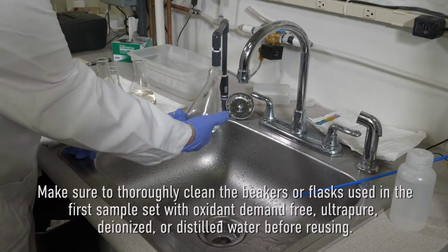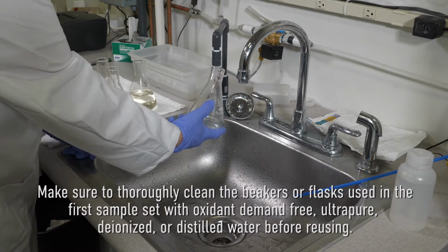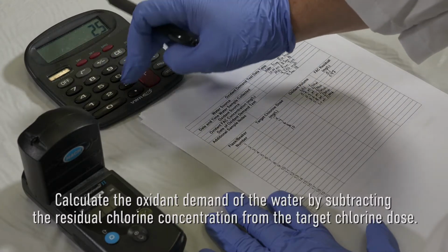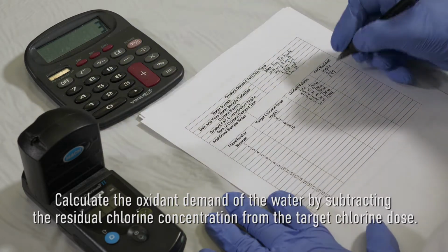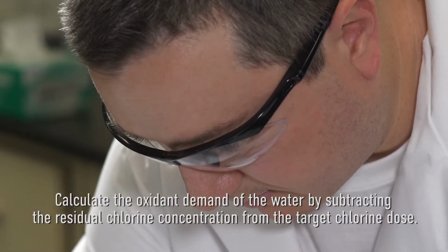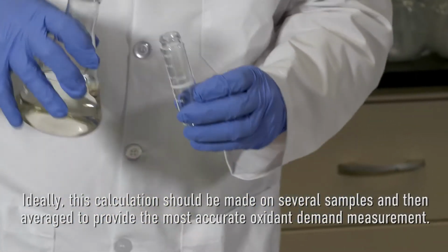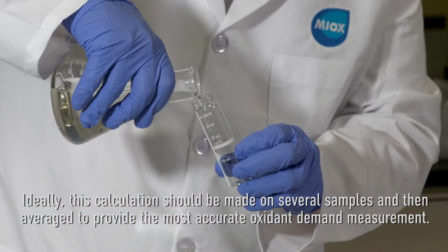Make sure to thoroughly clean the beakers or flasks used in the first sample set with oxidant demand-free, ultra-pure, deionized, or distilled water before reusing. Calculate the oxidant demand of the water by subtracting the residual chlorine concentration from the target chlorine dose. Ideally, this calculation should be made on several samples and then averaged to provide the most accurate oxidant demand measurement.